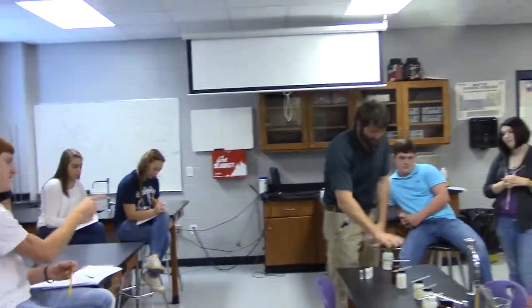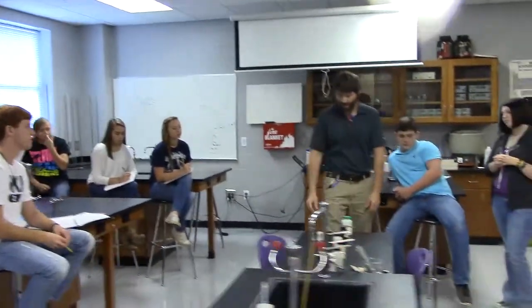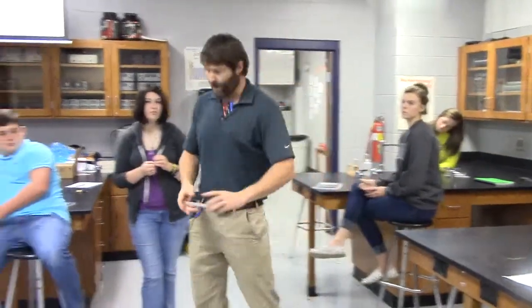put the lid back on, put the scoop back with it. Don't scoop. I don't want it laying down here, blah, blah. I want it set just like it was when you got in here. Now, this will be a good question.